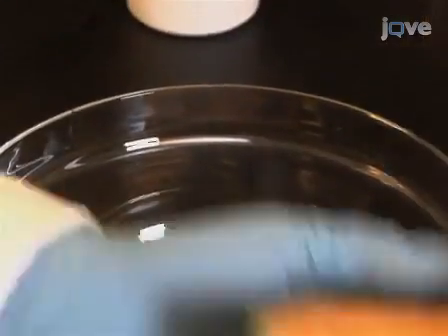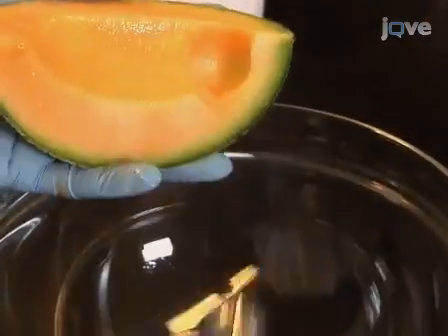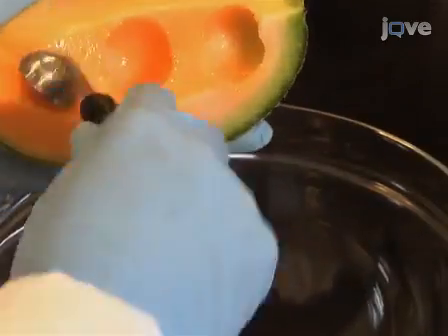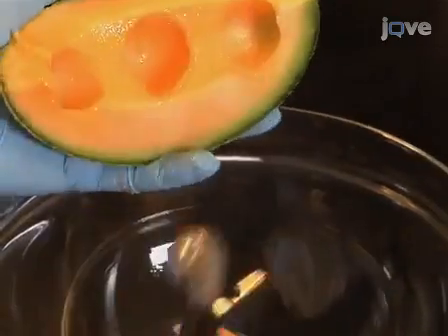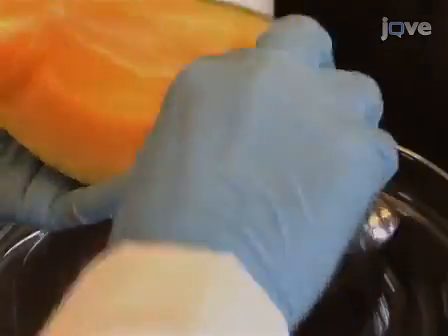Fruit tissue selection must be consistent throughout the experiment and variability within a single fruit should be taken into account. For example, samples should be obtained equally from the equatorial, blossom, and stem regions.